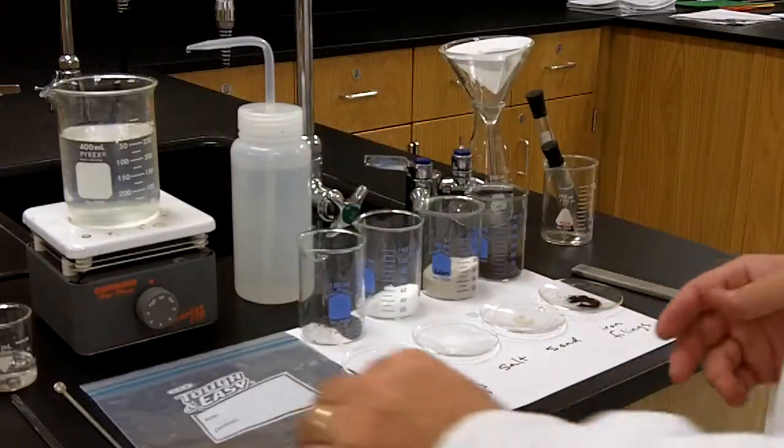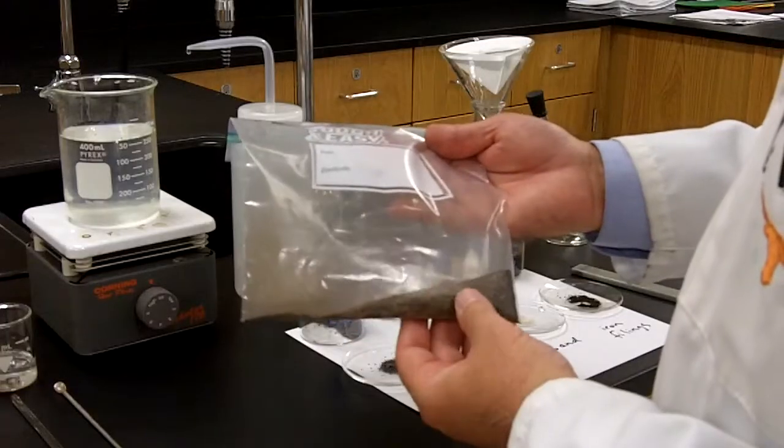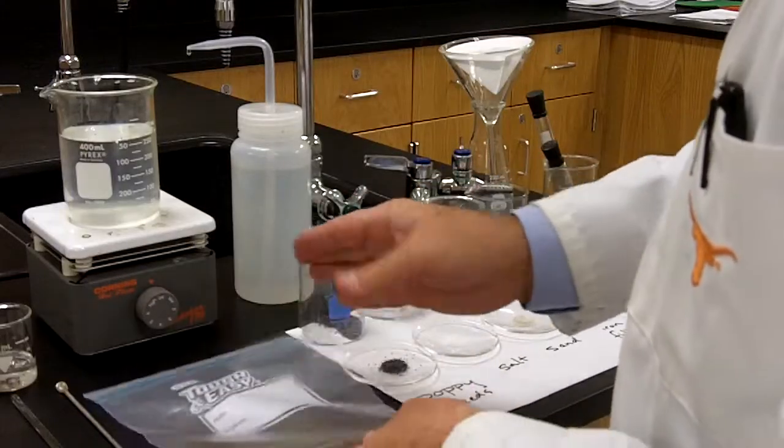So that's your job. Find out the contents, figure out how to separate all the contents of the bag, call me over, I'll initial your laboratory report, and you are done.